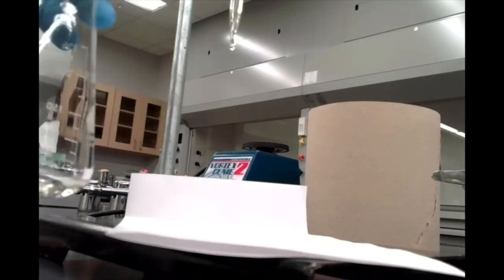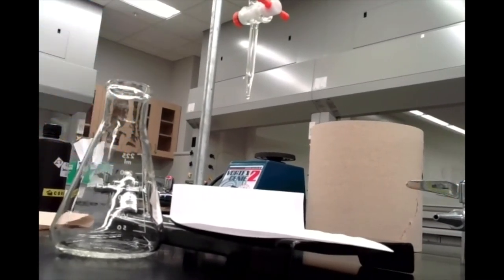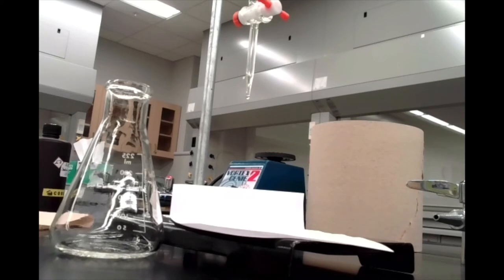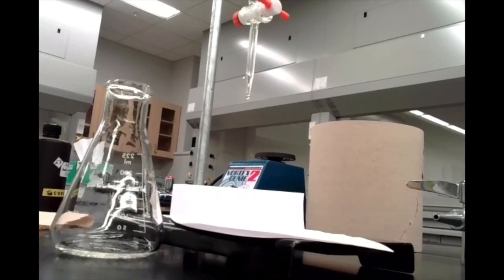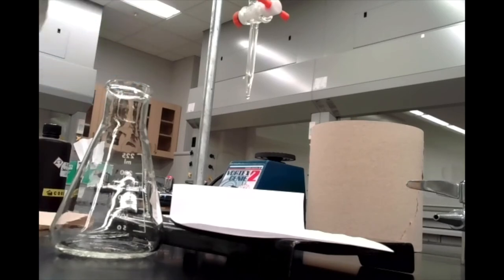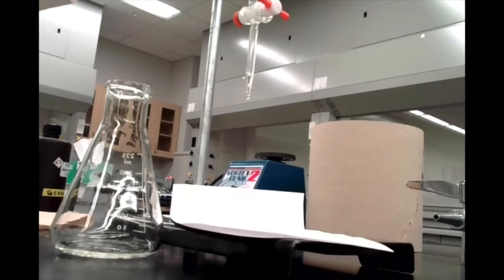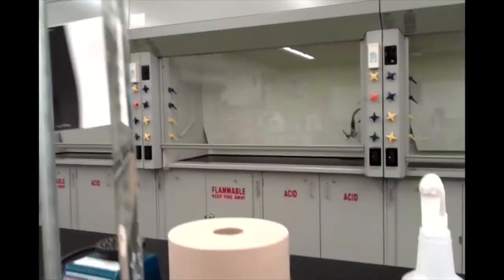Off camera, I've added five milliliters of vinegar to my Erlenmeyer flask and topped off my burette — not all the way to the top, but just past the 30 milliliter mark, so I know I have at least 20 milliliters in my 50 mL burette. That way I avoid wasting sodium hydroxide. Make a note of that initial volume now. I'll include a phone picture to make it a little bit easier to read.